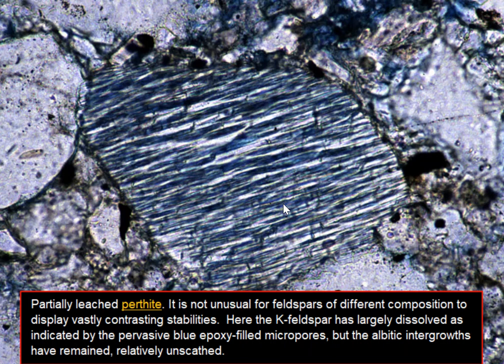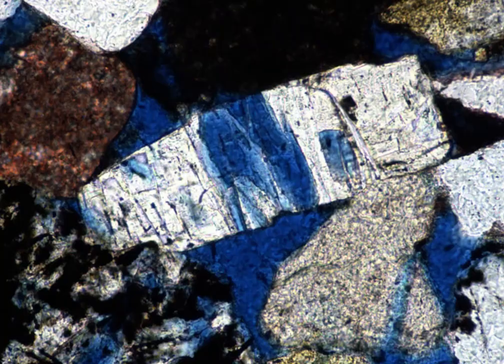Recall that perthite is a kind of feldspar where we have intergrowths of K-spar and albite, potassium-rich K-spar and sodium-rich albite. All right, there's a lot to look at here, so I'm going to zoom around. Here's our first bit of information about this.